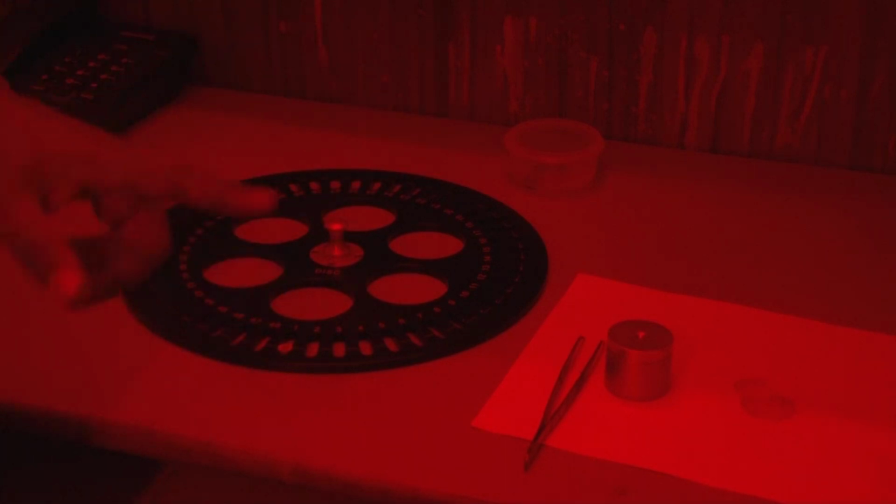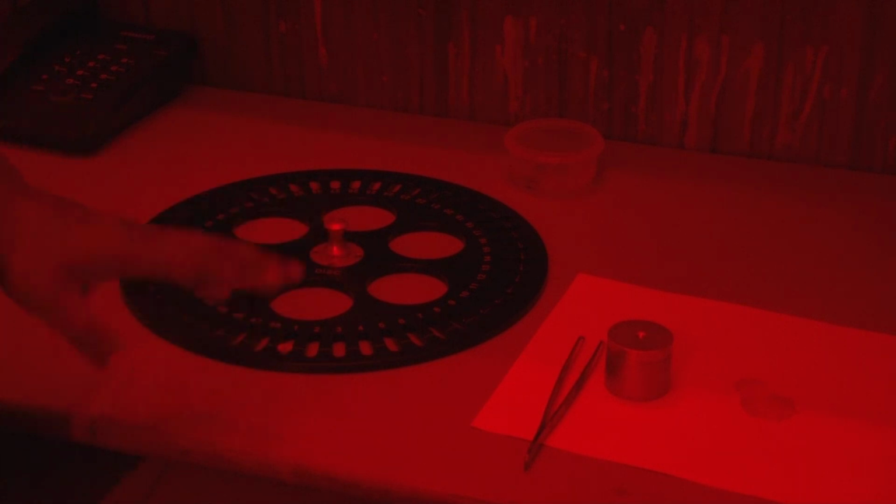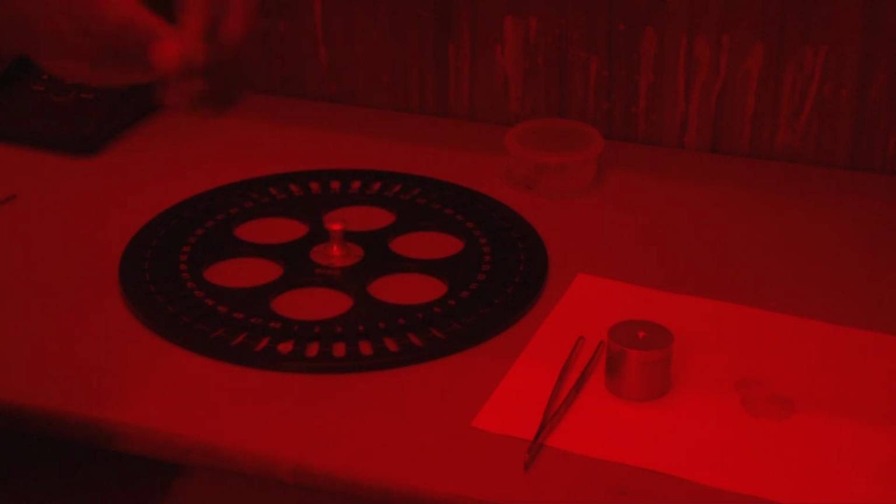Your instrument calculates the equivalent dose for all the individual aliquots, and the average of all these aliquots you are using for age estimation of your sample.